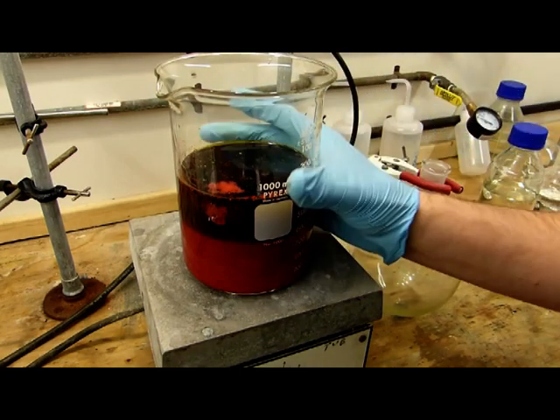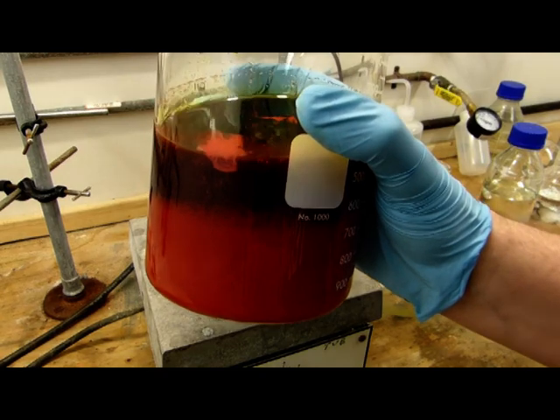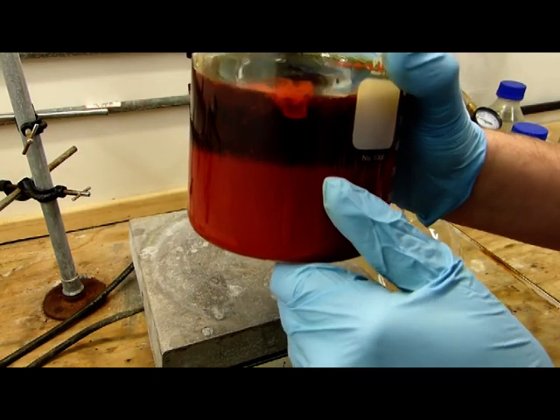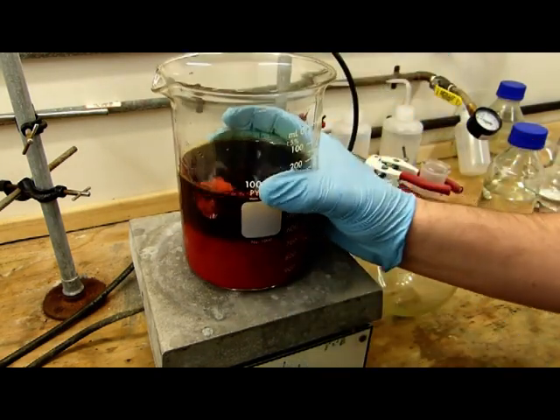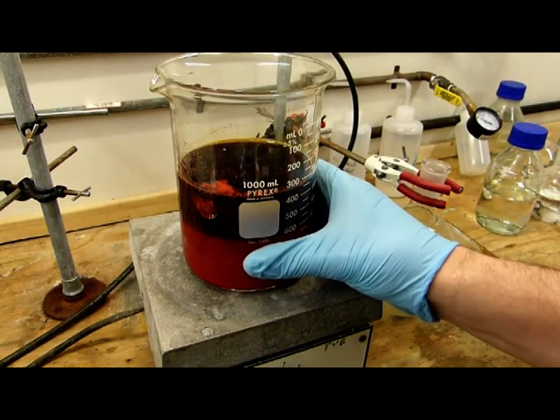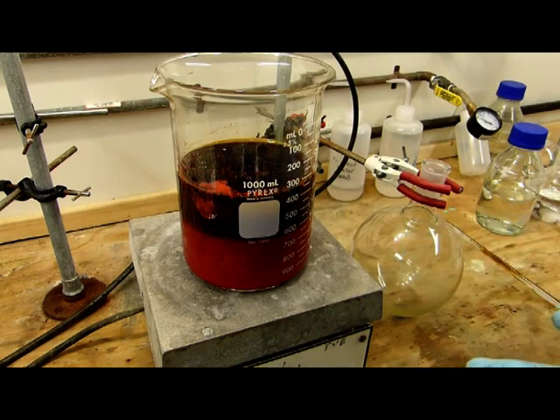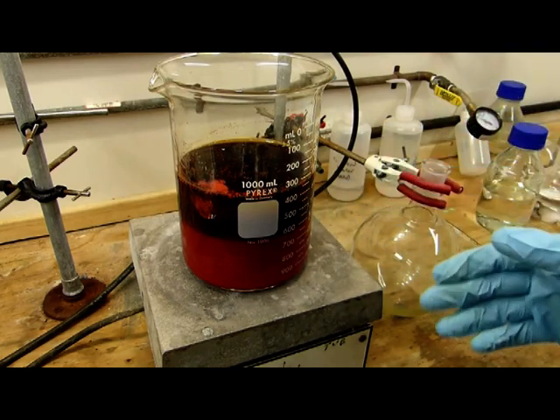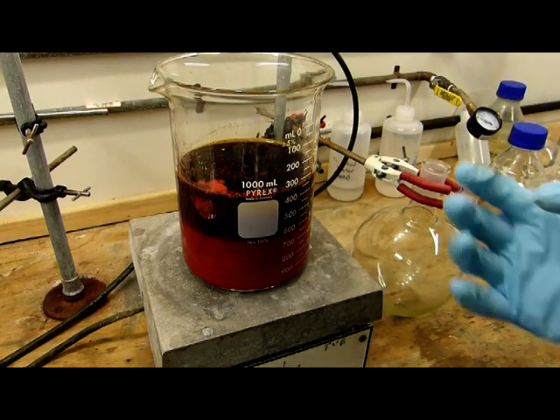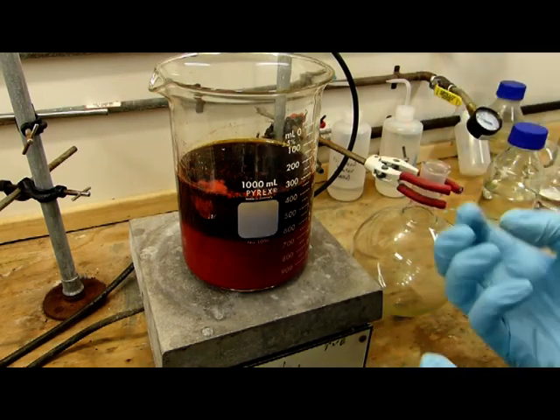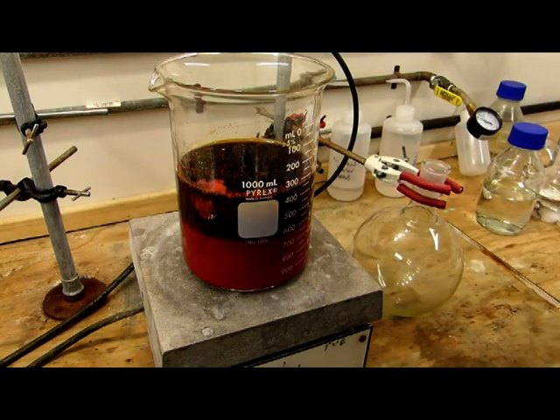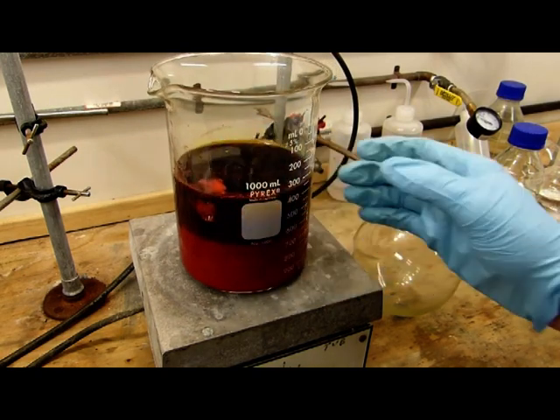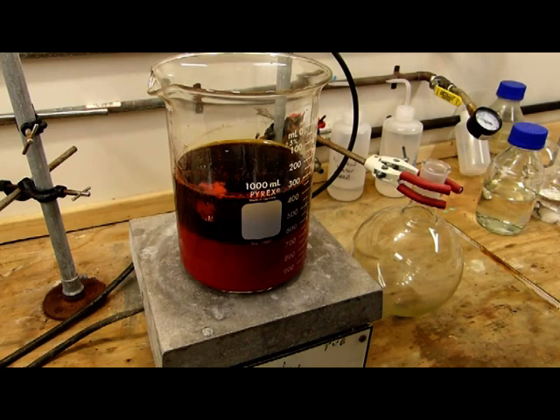It's been cooling overnight and you can see now we've got a rather thick solution with a lot of chromium trioxide precipitated, and so now we're just going to filter that out. These crystals are little flocs, they're not that big. I'm not sure if my filter will effectively filter all of the sulfuric acid, but it's just going to require more nitric acid to wash, so I'm not really that concerned about it. I could have heated this up to approximately 100°C and cooled it down repeatedly to increase the crystal size, or cooled this more slowly by wrapping it in towels, but I think for all intents and purposes with this much, I'm not going to waste too much nitric acid washing the sulfuric acid out of it.